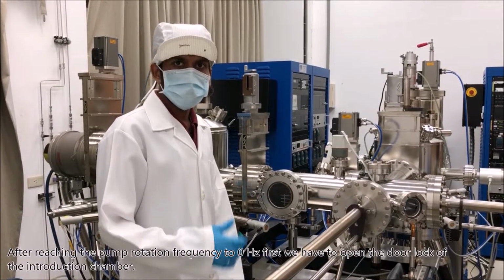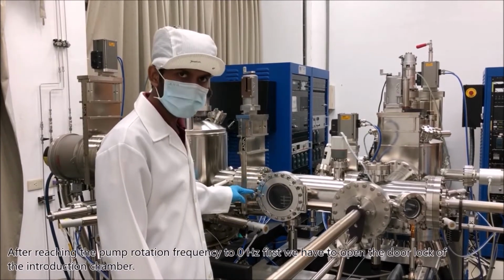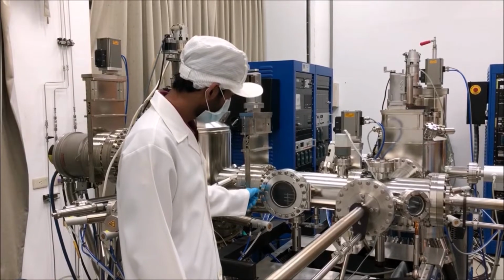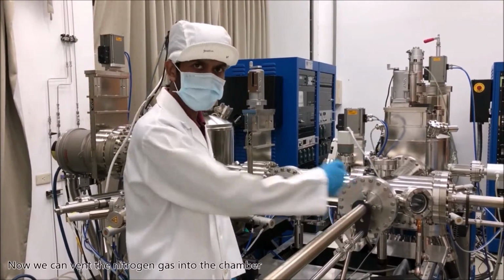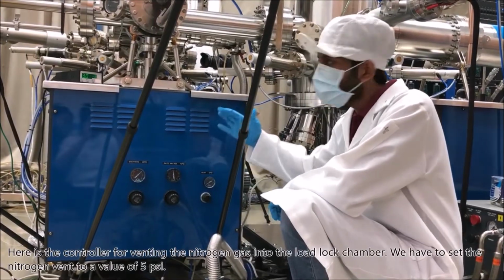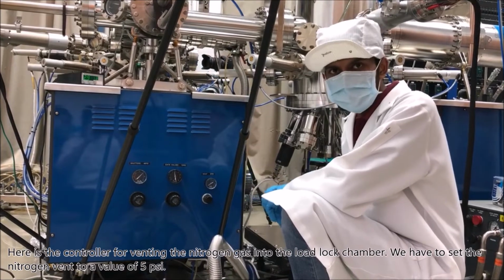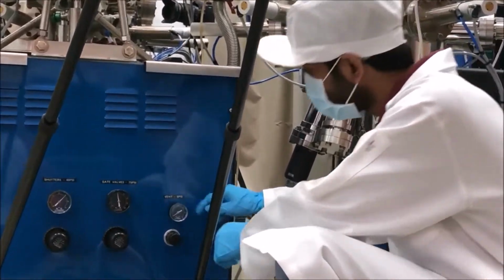After the pump rotation frequency reaches 0 Hz, first we have to open the door lock of the introduction chamber. Now we can vent the nitrogen gas into the chamber. Here is the controller for venting the nitrogen gas into the load lock chamber. We have to set the nitrogen vent to a value of 5 psi.